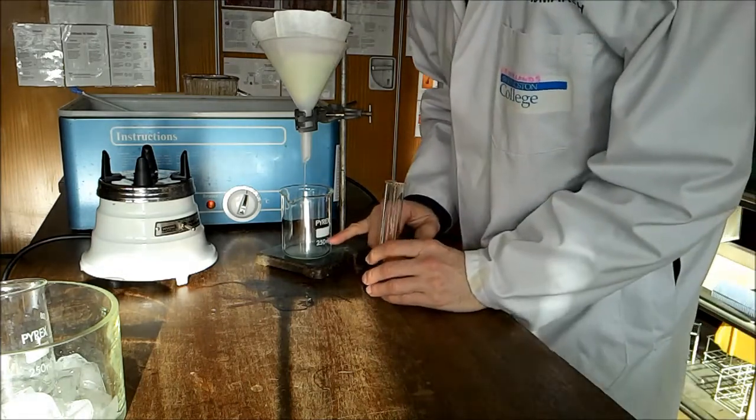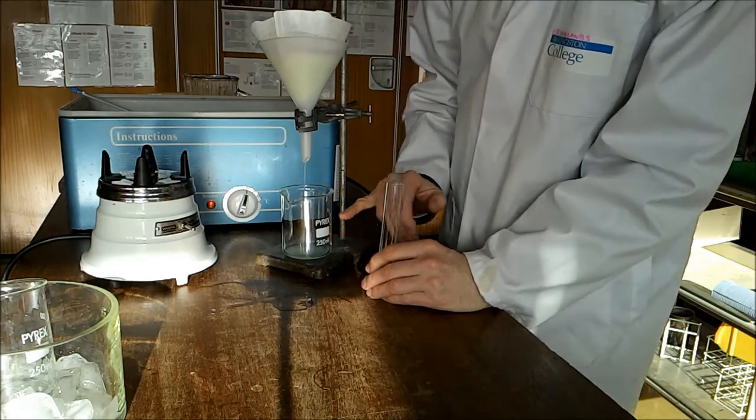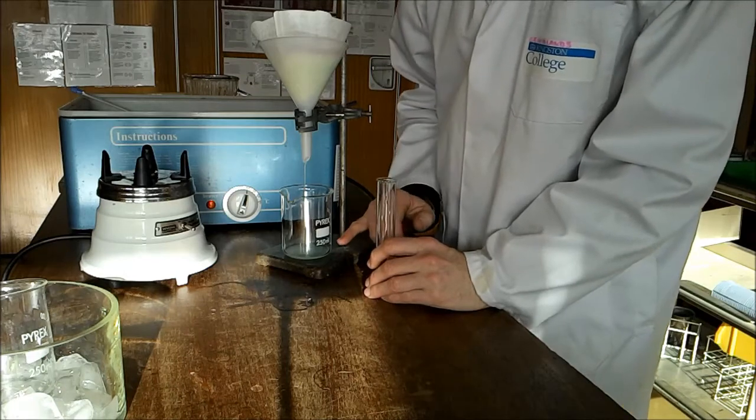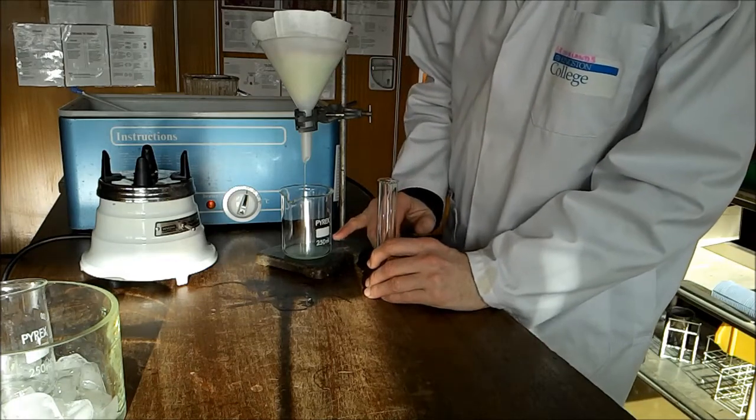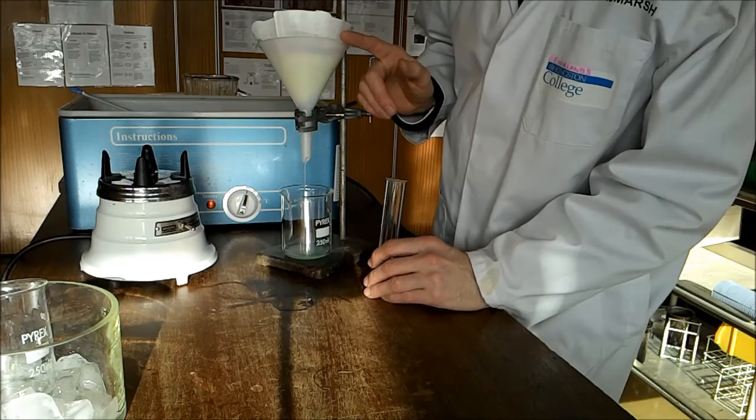Now this filtrate solution will contain our DNA. It should be relatively pure and we have taken out the cell walls and the debris from the cells.